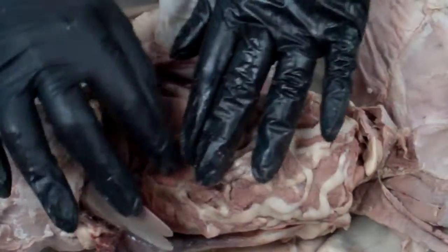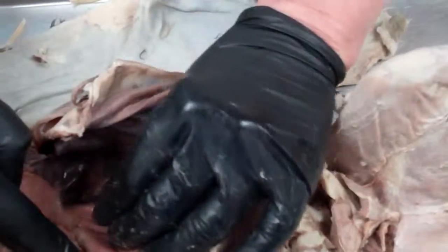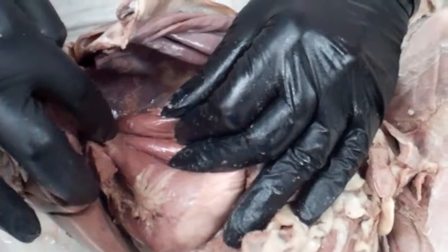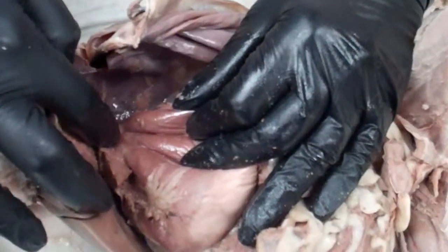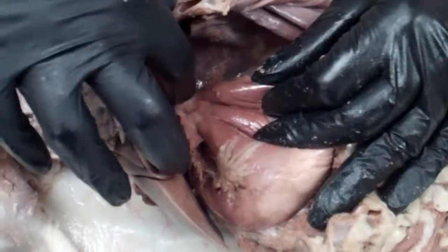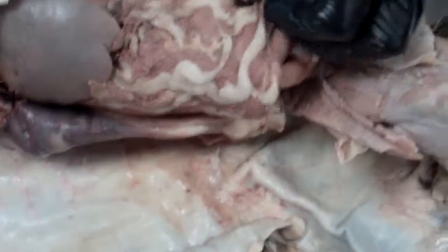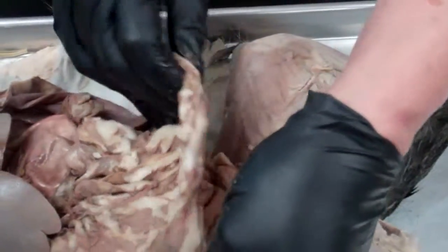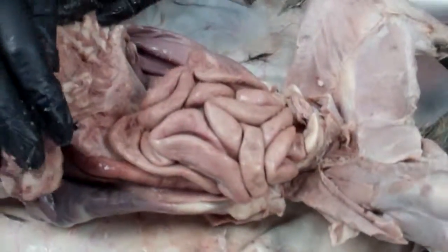Okay, to see the rest of the organs, one more thing before we get down here. If I pull the stomach down really far, you can see this top part here. This is where the esophagus hooks to the stomach, and there's a valve right in there that we'll be looking for called the cardiac valve. And then we're going to take the omentum. We're going to gently, it isn't fastened on the bottom, so we're going to gently lift it up. And now we're looking underneath the stomach.